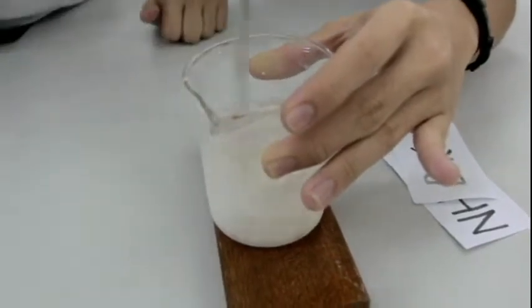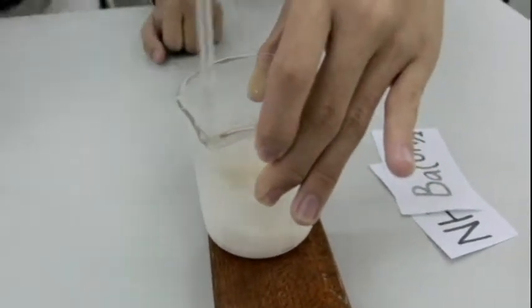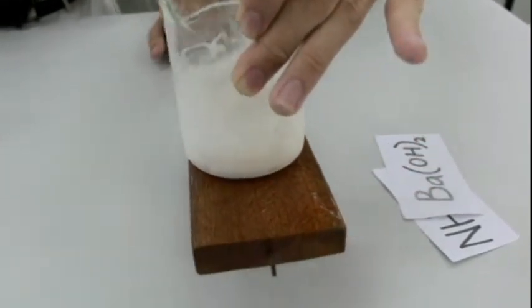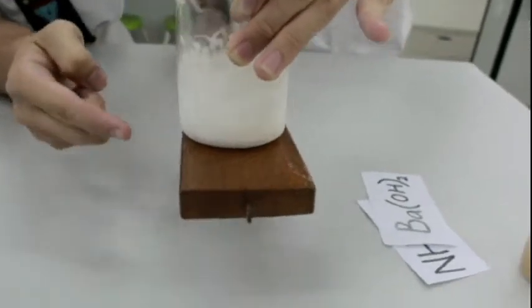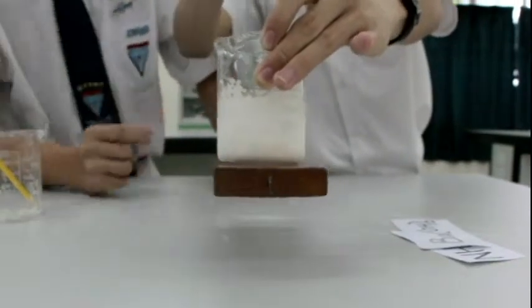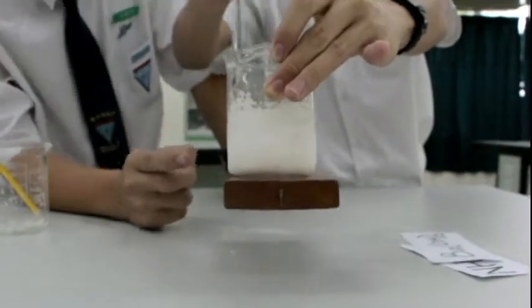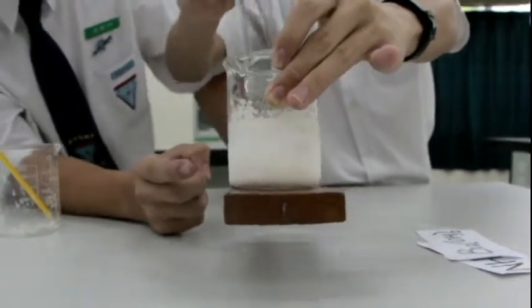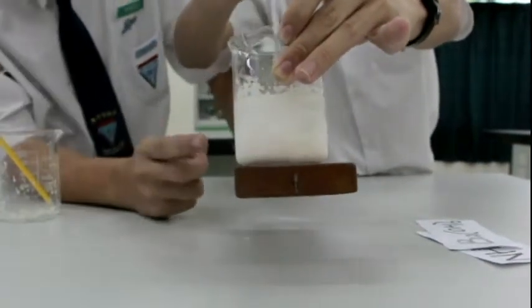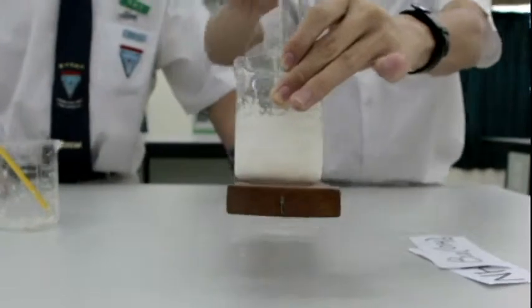Oh, the smell is really awful. Oh, you see, it has actually frozen the water below, and this water block sticks to the beaker. You'll see the power of the endothermic reaction between ammonium chloride and barium hydroxide. It absorbs heat from the surroundings, thus producing a very low temperature at minus 10 degrees, which freezes the water below and sticks it onto the beaker. That's the result from the endothermic reaction.